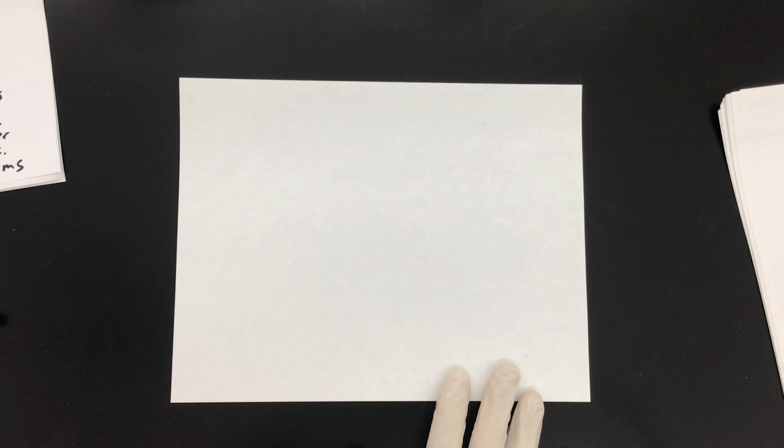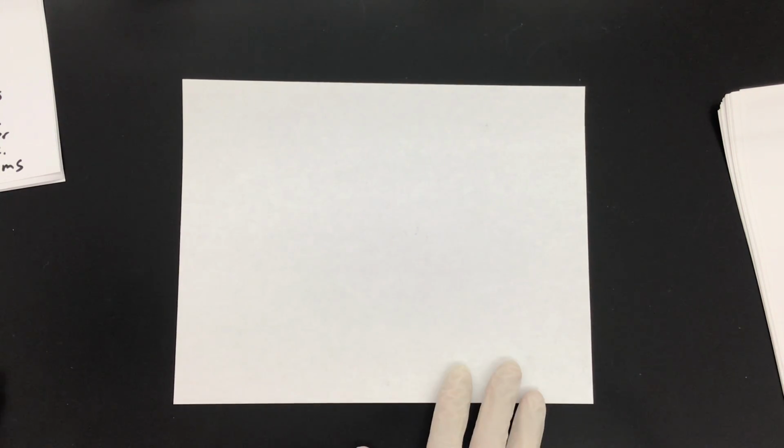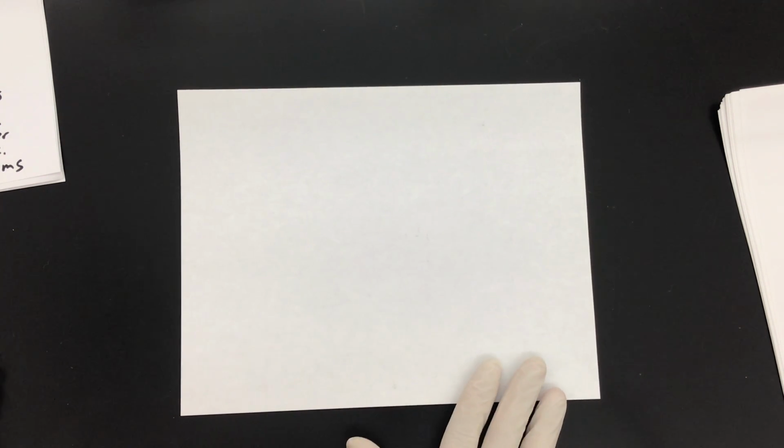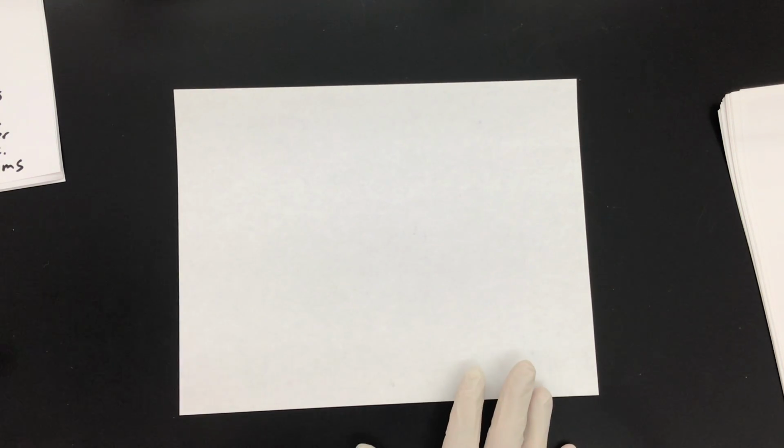So I have a pig's heart, actually, and these are not the fetal pigs that you were going to dissect, but these are full-size pigs that have been slaughtered for meat. And I literally go to the meat market to buy them. And so this will be a full-size pig heart that's probably almost the size of a human heart, actually. So it'll give us real good detail of the size of the chambers and the valves and all that. And that'll be hopefully fun to watch.